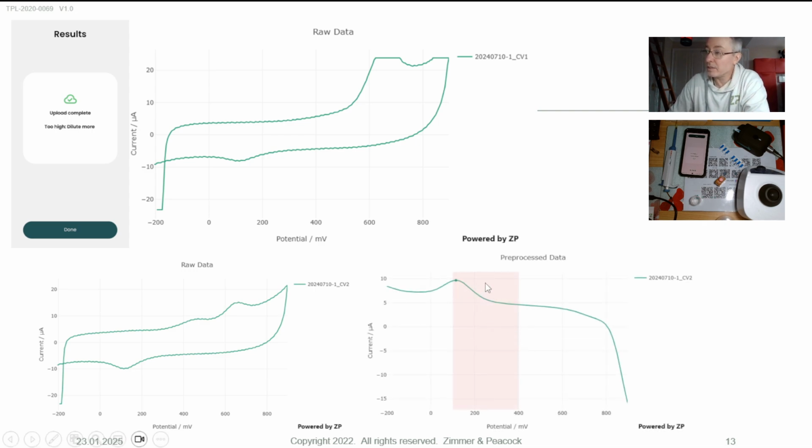Again, when the system analyzes it, you can see it's finding this nice clear peak. Boom, there is a peak there. And I know that their dilution factor is 10, but I can see that the equipment has said they've gone from too low on the same sample to too high on the same sample. It's not like in the first test, there were no capsaicin peaks.